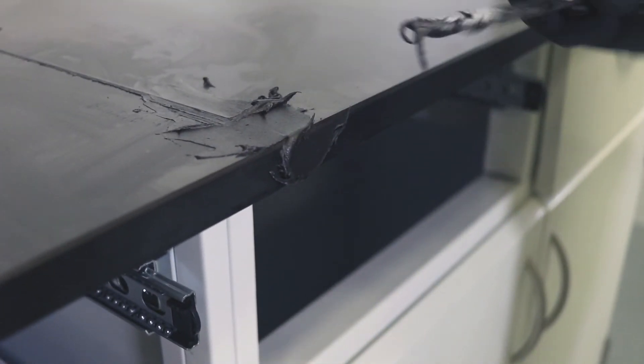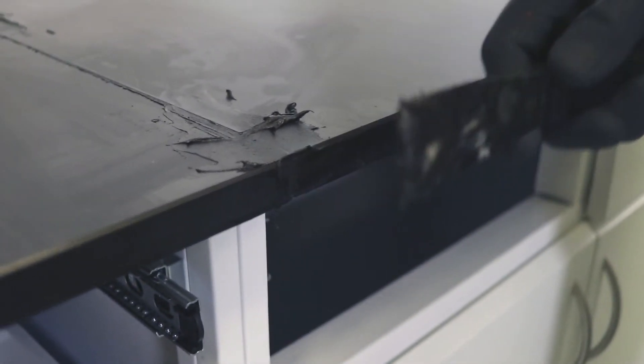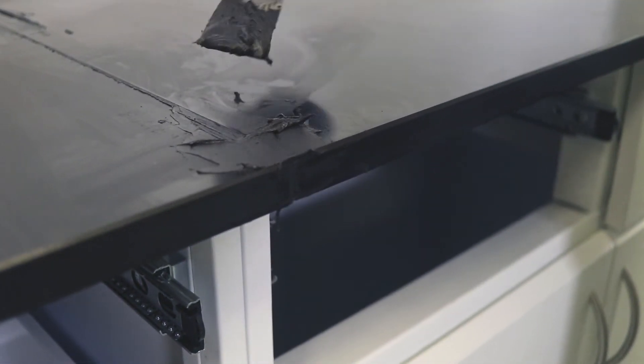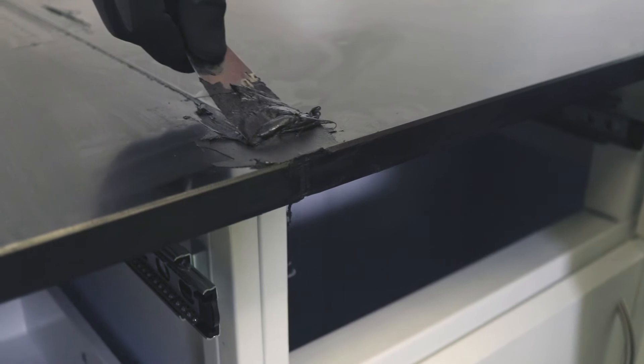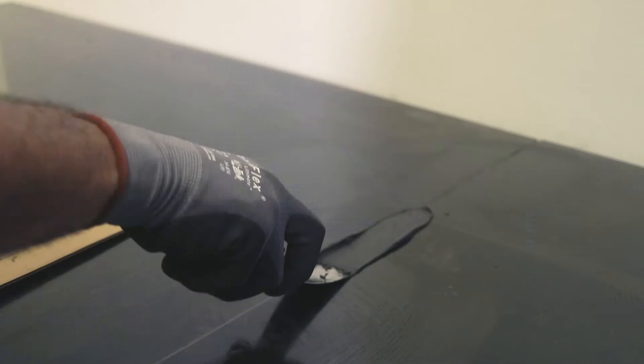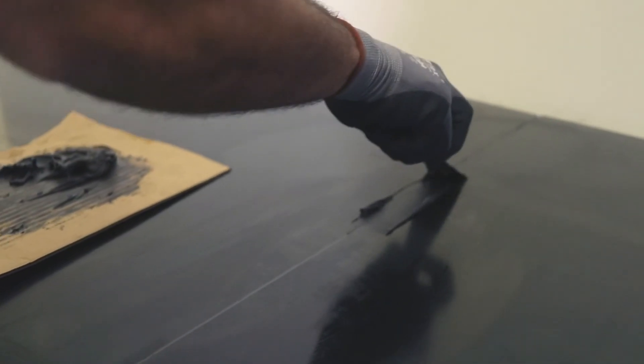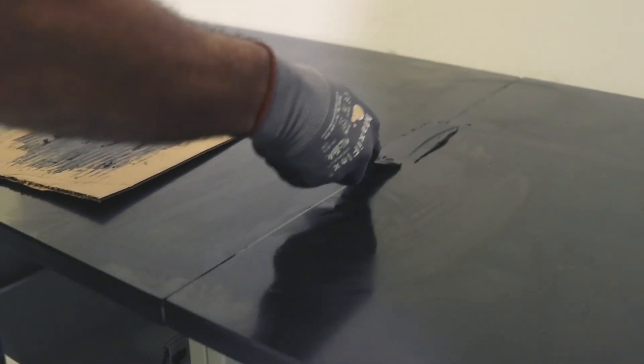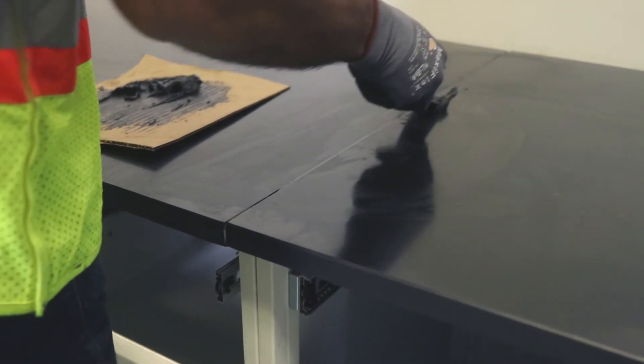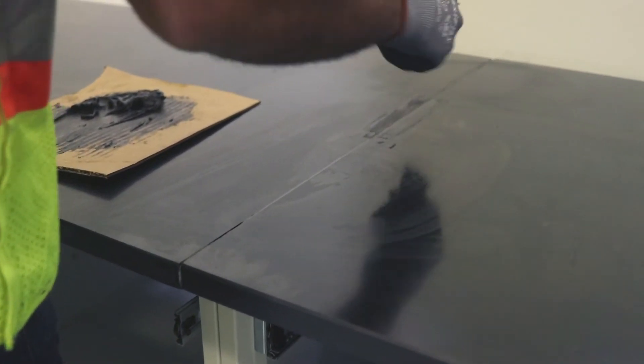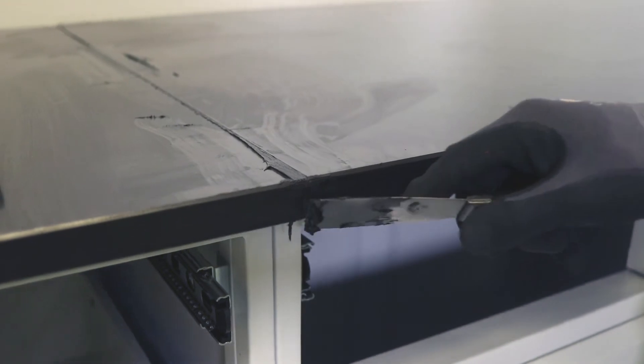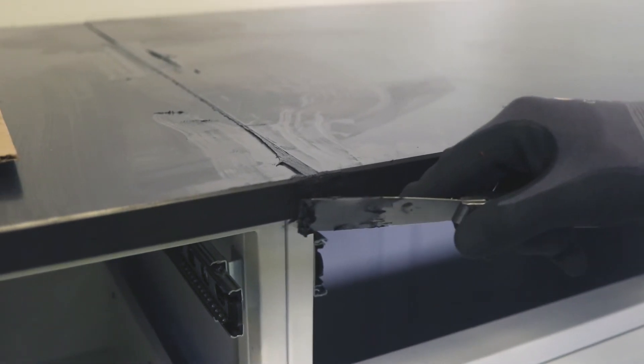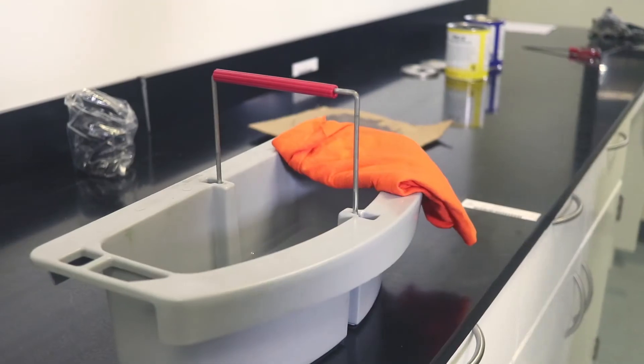Once the joint is correct, the epoxy cement is applied with a putty knife, pressing the cement into the groove several times until enough cement has penetrated the joint. When the groove is well filled, the excess cement is removed with a putty knife, being careful to avoid scratching the surface and leaving it even with the surfaces on each side.